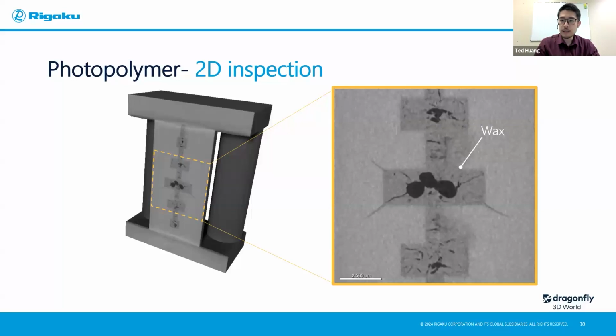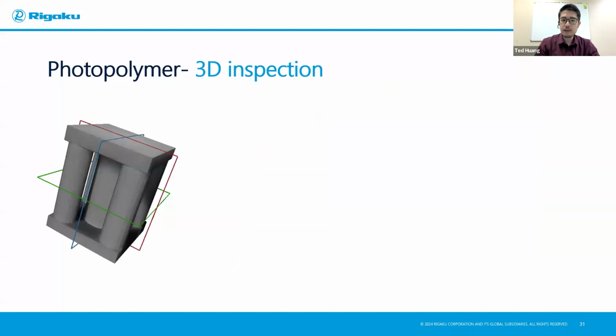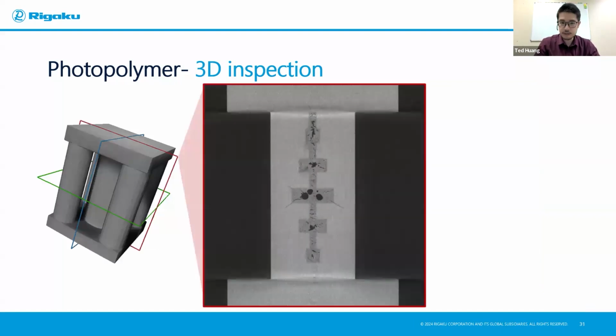There are pores happening. And what's surprising even to me here is the stress actually caused a crack that's growing into our printed material. It's not just limited to the wax. That's a proper structural weak point, right? So we have a crack that grew into the printed material. If I were to use this under a stress condition, it might just crack and crumble from there. Now, we don't have to just stop at 2D inspection because now we have full 3D access.